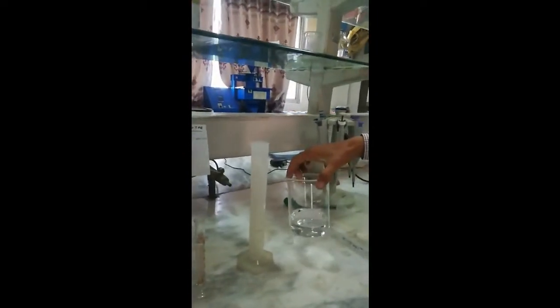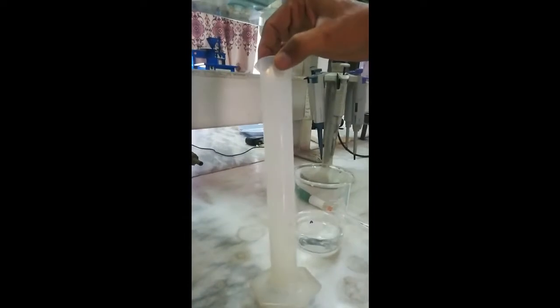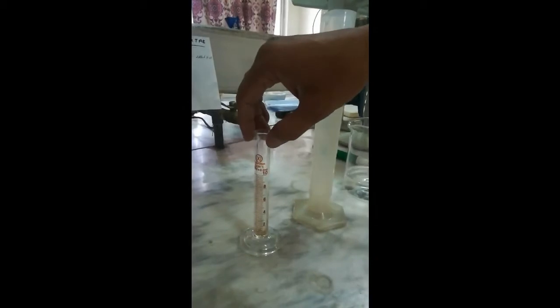Today we will talk about measurement of volume. There are different equipment that could be used for the measurement of volume. For larger volumes we have a beaker, or we have measuring cylinders — for example, this is a cylinder of 100 ml and this is a cylinder of 10 ml.